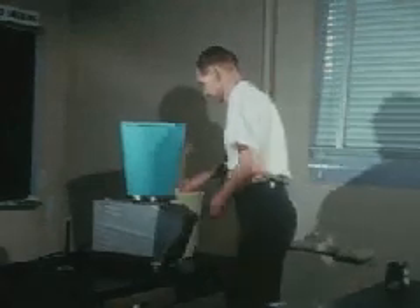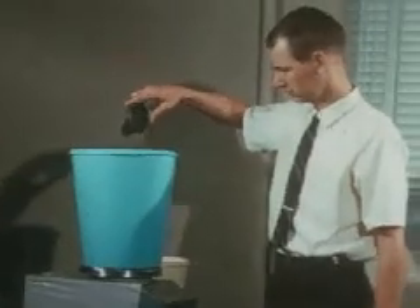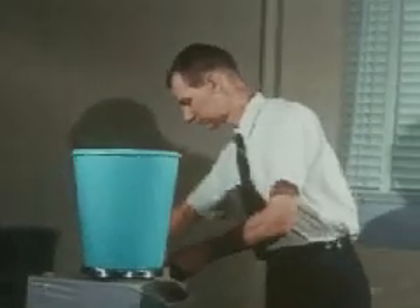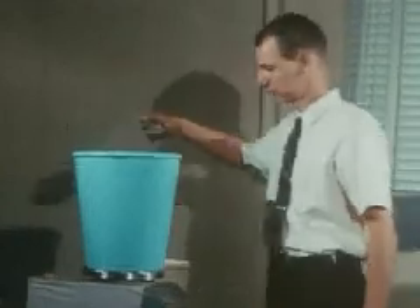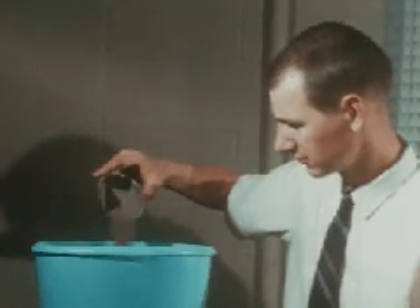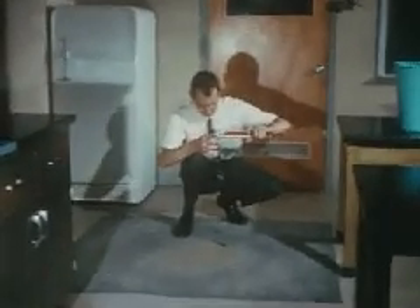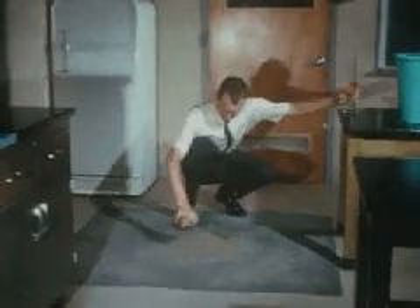The soil which fills a compartment is air dried and weighed. Here he is weighing a dark brown sandy loam topsoil, but he could be weighing a subsoil of some kind. The soil is then mixed with a measured amount of water. Various chemical treatments can be incorporated at this point.